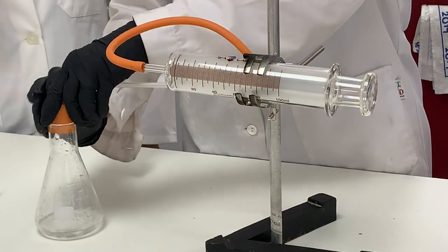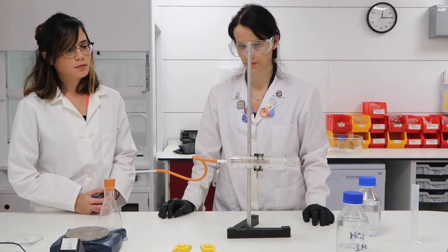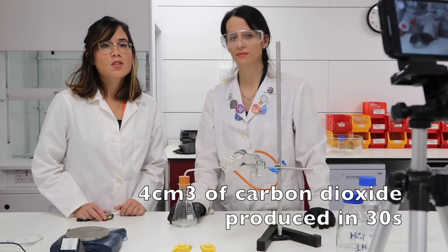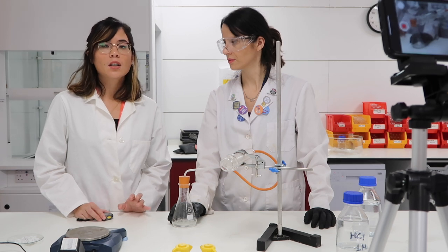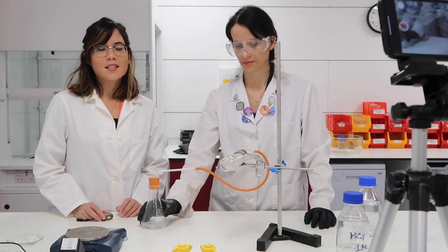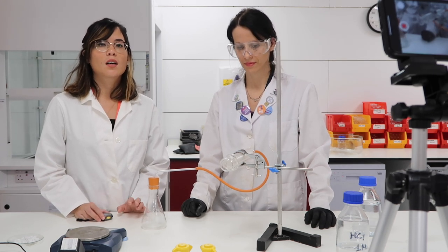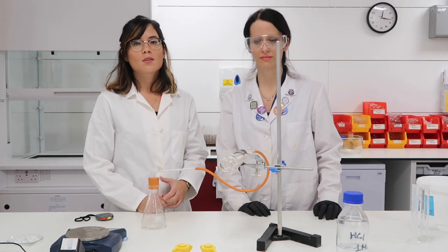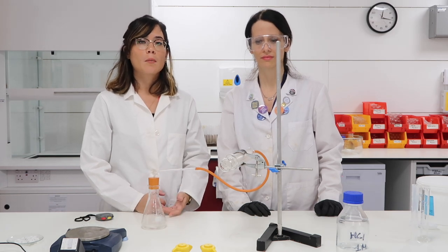The stop clock has been started, bung replaced, carbon dioxide will be being produced. The volume produced is 4 — so we produced 4 centimetres cubed of carbon dioxide. That's in comparison to when we had the much stronger acid when we produced 10 centimetres cubed. We can see that the rate of reaction is much quicker with the higher concentration. To calculate the rate of reaction it's a simple equation: change in volume over time, and that gives you a numerical value you can compare properly.